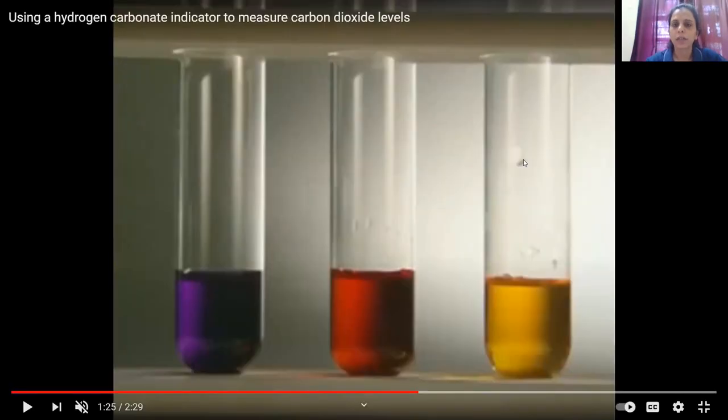Now you have to just place all these 4 test tubes for 30 minutes to 1 or 2 hours in bright sunlight. Now you can make out, after keeping the test tubes in front of bright light for a few hours, the test tube A, this is your test tube A, the color has changed to purple. Test tube B, the color has remained the same, that is reddish orange. In test tube C, the color has changed to yellow.